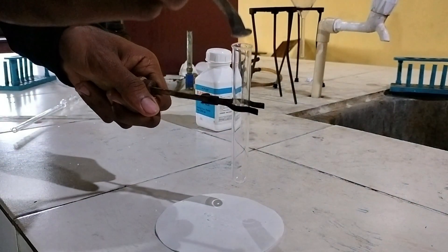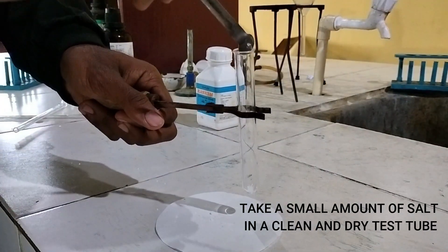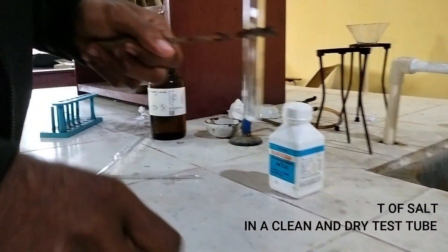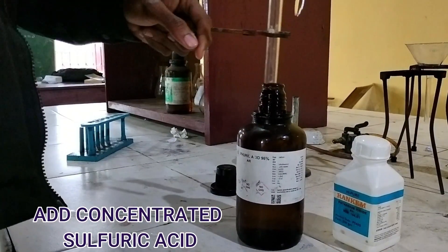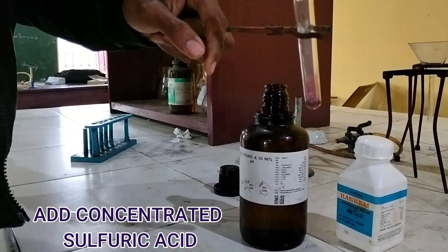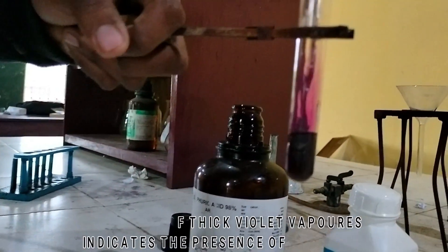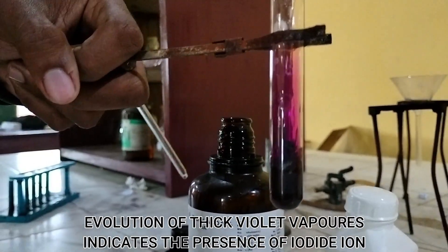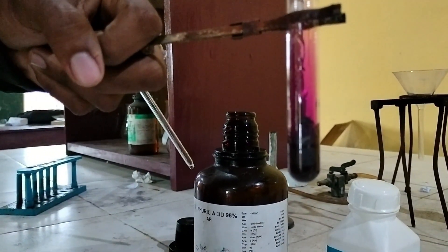Again, take a small amount of salt in a clean and dry test tube and add concentrated sulfuric acid. Evolution of thick violet vapors indicates the presence of iodide.